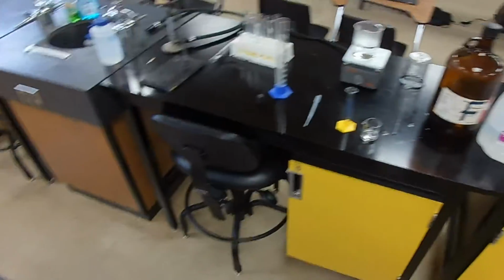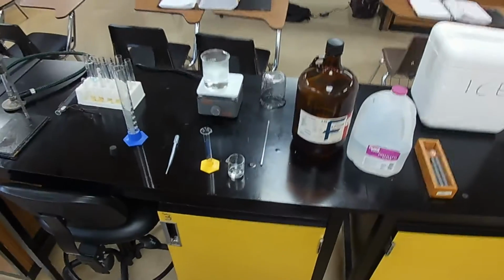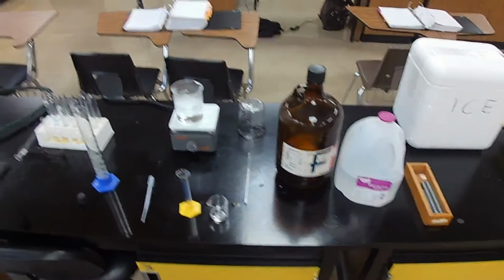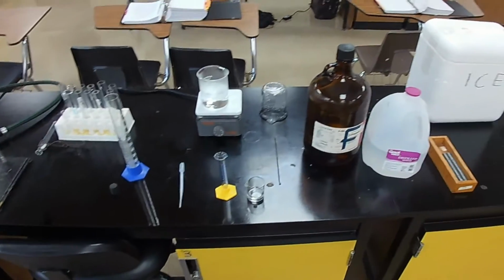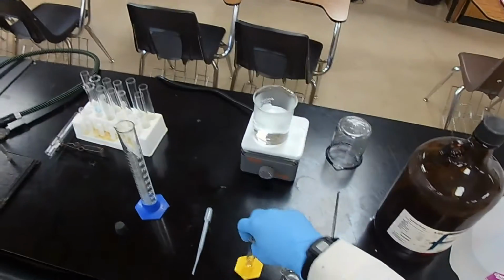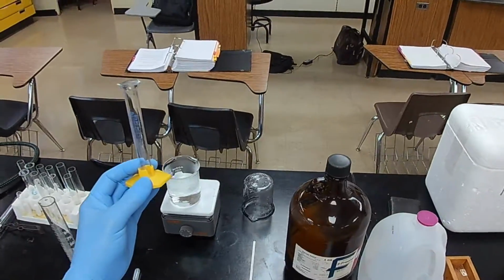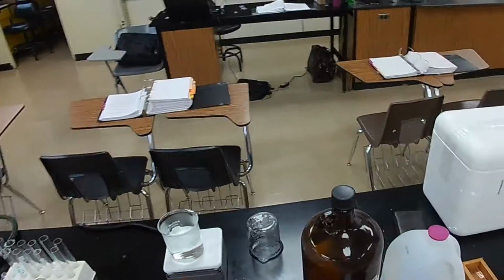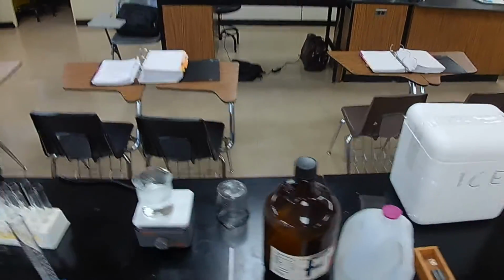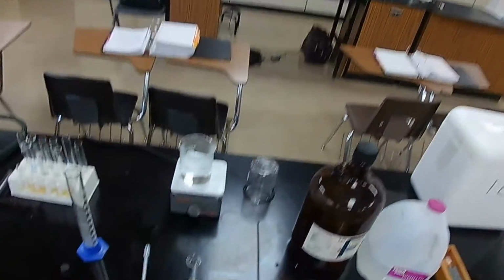Now, how are we going to determine the density of that liquid? What do we need to know to do the density? Look at the formula. We need a mass and a volume. So how do we get the volume? The volume is just measured directly from the container. How do we get the mass of a liquid, though? You can't carry the liquid over there in your hand and slop it on the balance and get a mass. It has to be in a container because it's a liquid. So we do it by difference.